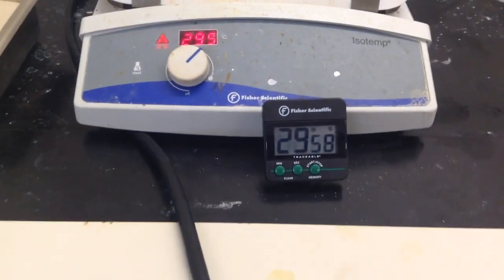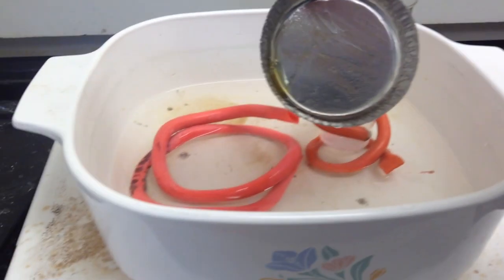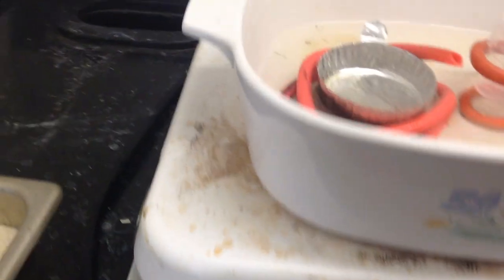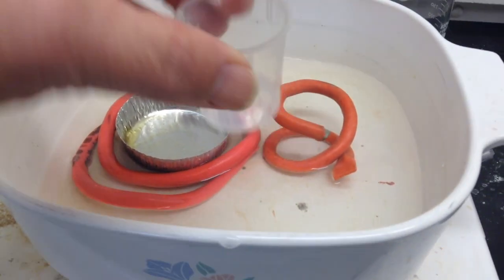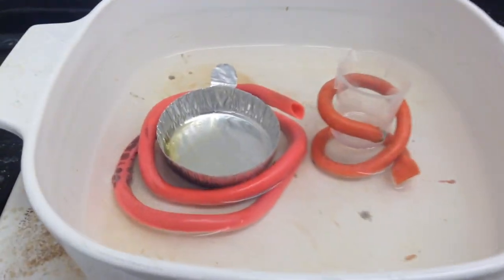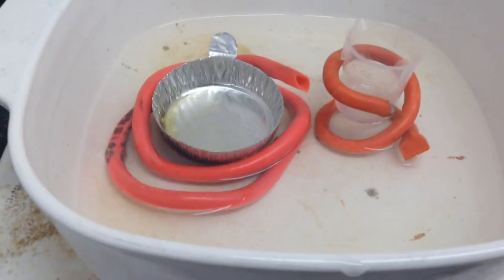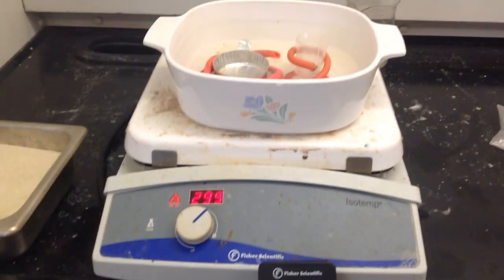About a half an hour in, we can see our two products. The aluminum pan — a lot of the liquid has gone away and it's turned a little bit yellowish. The plastic beaker still has some liquid-like material, although it's turned a little bit thicker and gel-like as we let it heat. We're going to put it back in for another half hour or so.